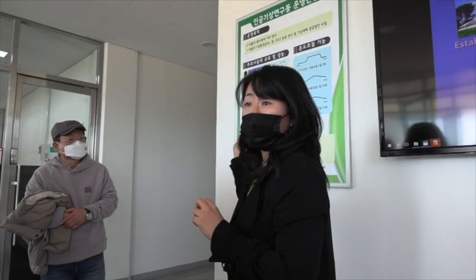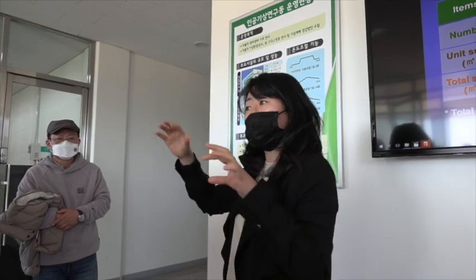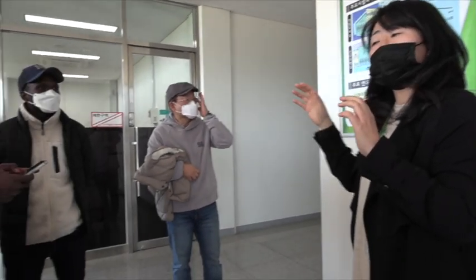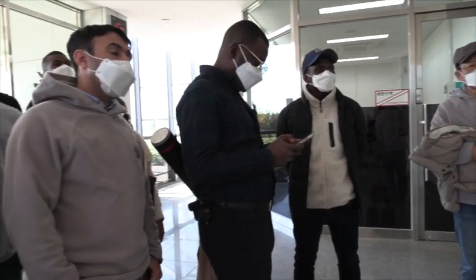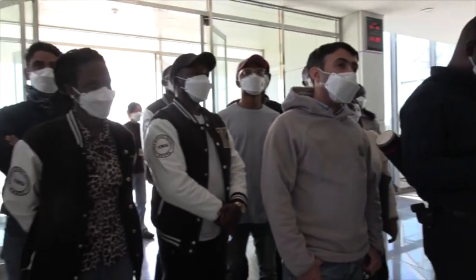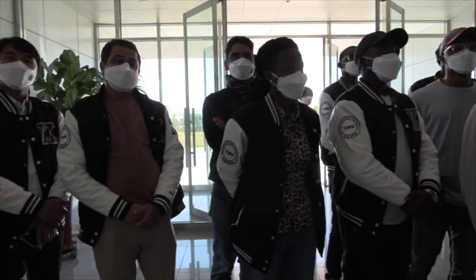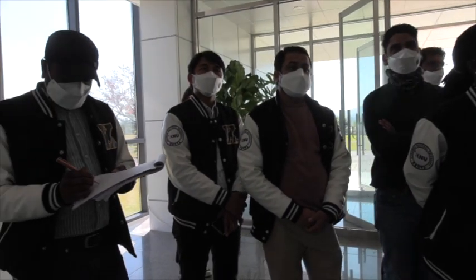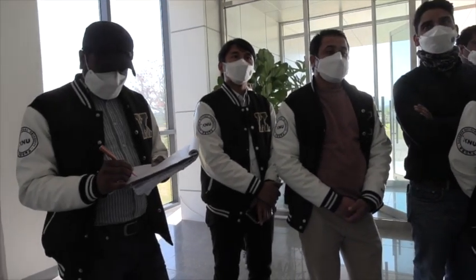We have six cabinets in here. We can control the temperatures, the day length, the light density, and the carbon dioxide content. So in here, we normally cultivate rice.